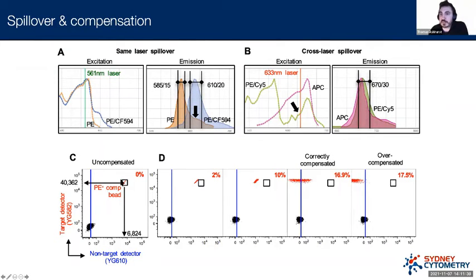Now, if these beads were at 40,000 in their own detector and 40,000 in another detector, we would call that 100%. I only raise that because I want to point out that this is just a mathematical ratio. The higher number doesn't necessarily mean the worse the spillover. The way we tend to interpret it is that the higher the number, the worse the problem, but it's not actually as straightforward as that. We'll come back to that as we explore a few examples later. But what I want to hammer home here is that the value is simply a ratio from where it is in its own detector to where it is in another detector.